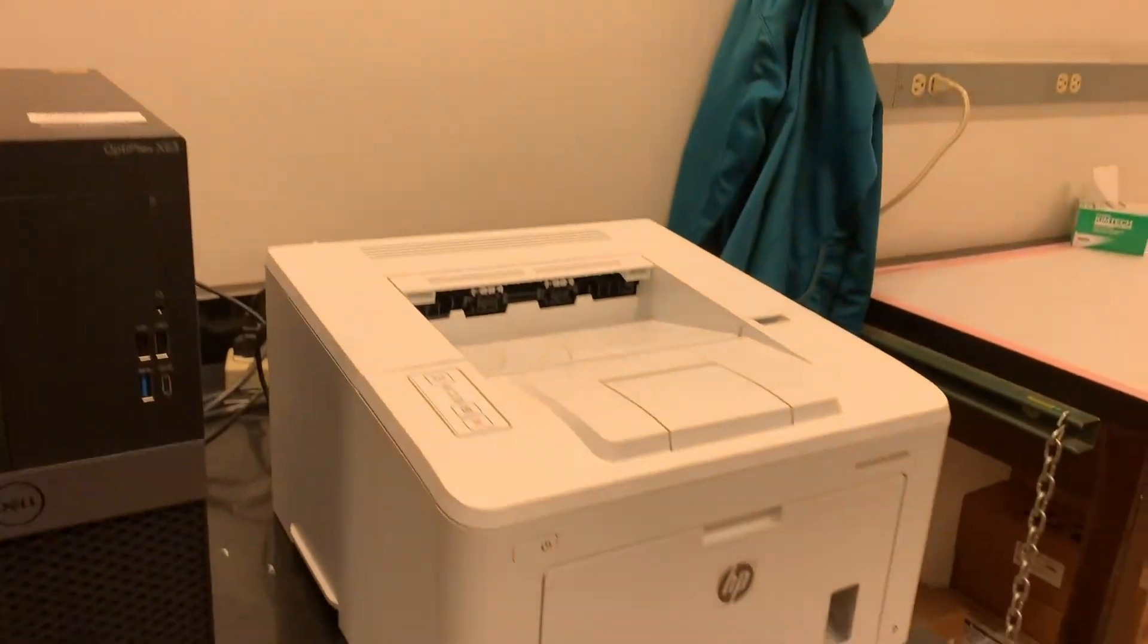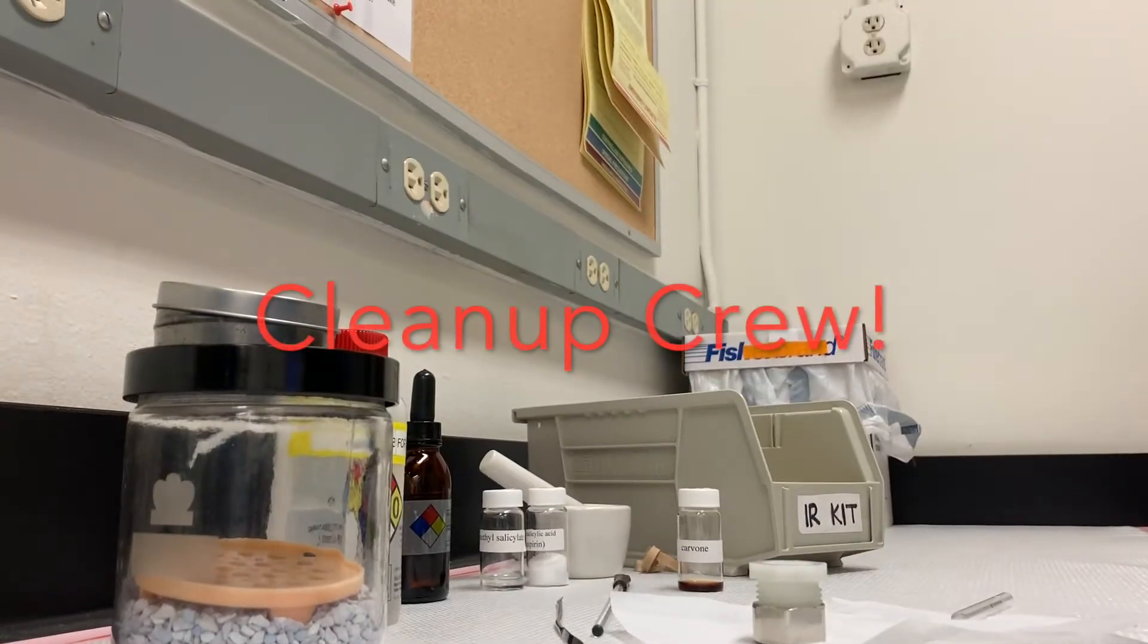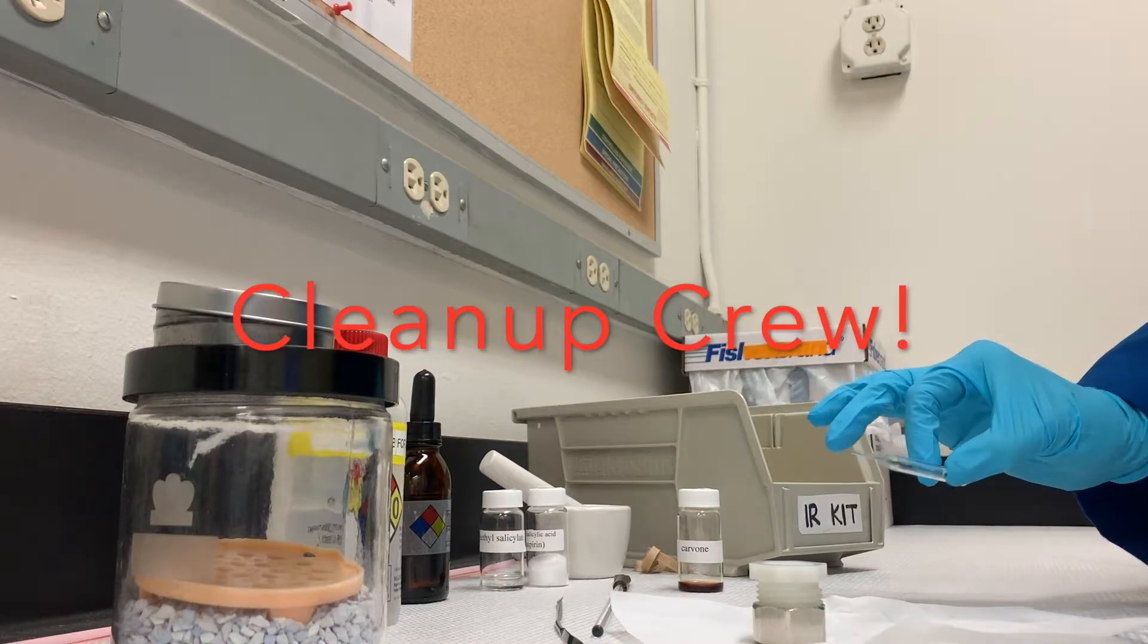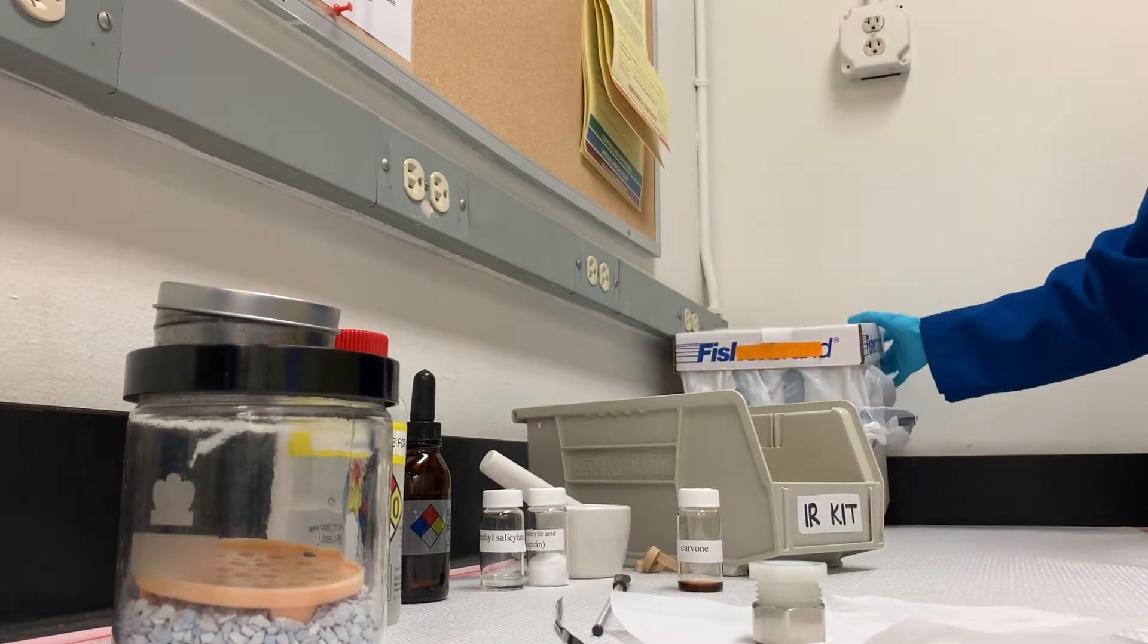There's a printer right there. Good times. We're going to show cleanup here. So first of all, the pipette we used is going to go into this glass waste box. It says use pipettes only.